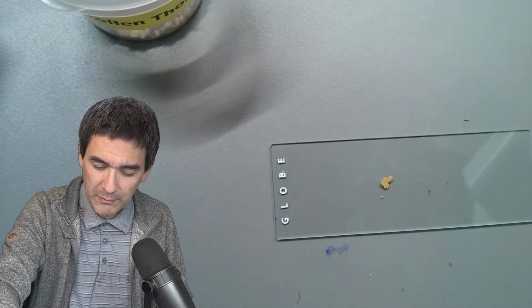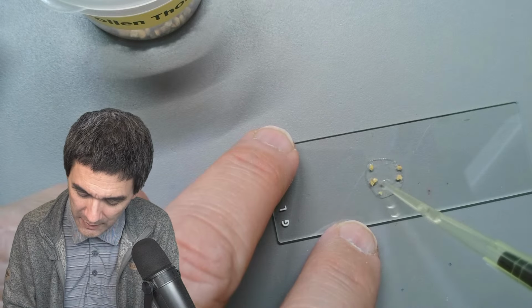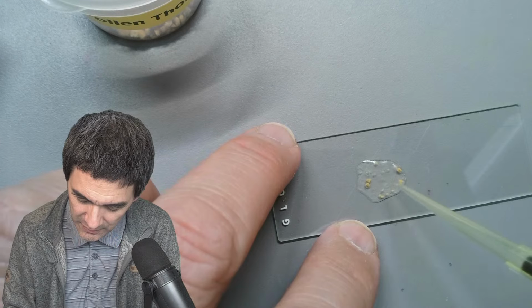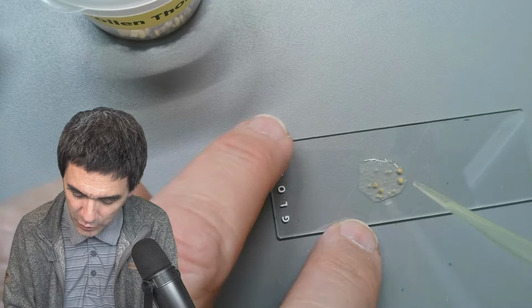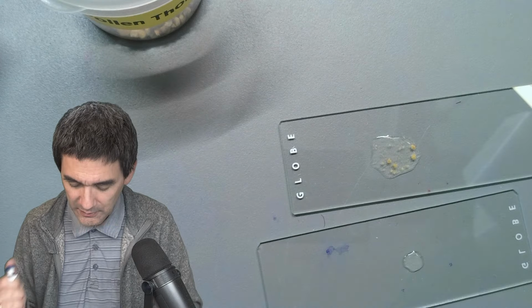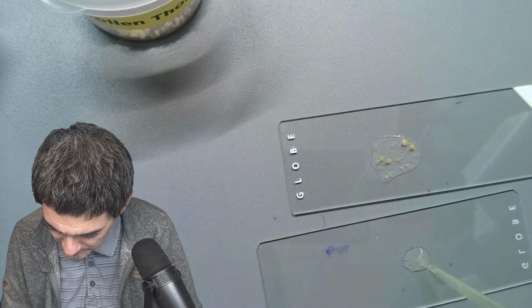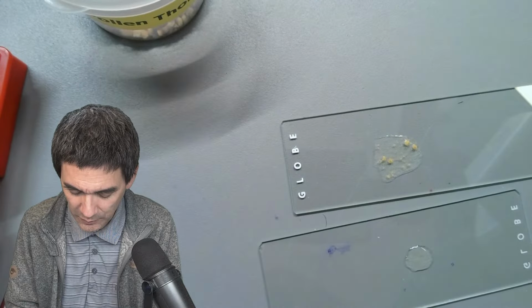Okay, I'm going to think about this. I'm however going to use a different microscope to do this hour-long live stream, and I have not tried this over a longer time yet. It was just experimental, but I do need a proper source of microorganisms, at least of sufficiently high density, so that people can actually see something. This is way too much water. So what I'm going to do is transfer some of this over here. And maybe I'm going to take a little bit more pollen. There's going to be plenty. And then I'm going to call it a day afterwards.